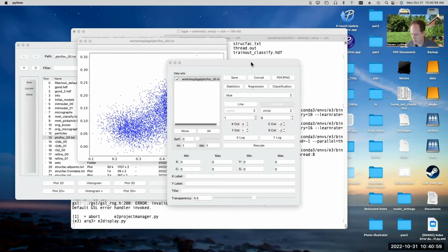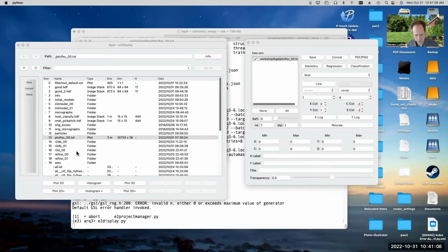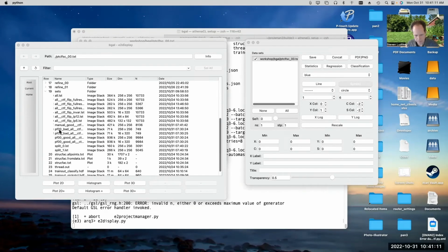Let's try it again. Again, you don't normally have to do this manually. It does it automatically for you when you run the program, and if we look in sets here, it will produce PF00 bad and PF00 good. So you can see it found 749 particles that it thought were bad and 9,984 which it thought were good. So you could then run another refinement on this data set. This is a small enough number of bad particles, and they're mostly going to get automatically excluded anyway. It's probably not going to have any really major impact here.